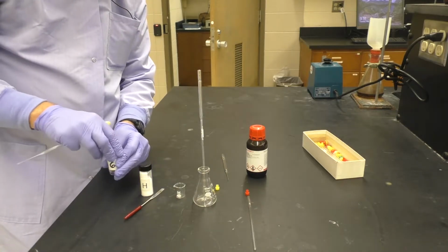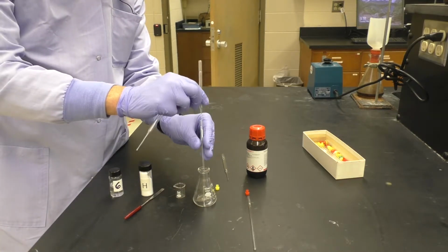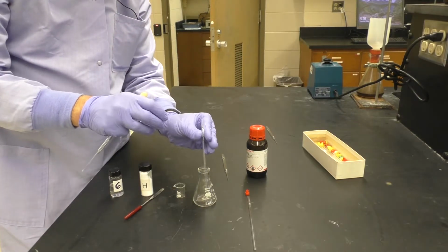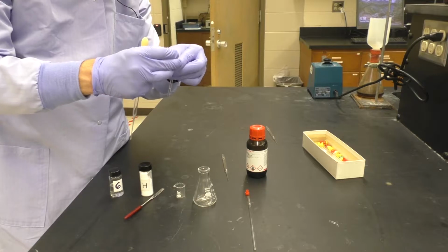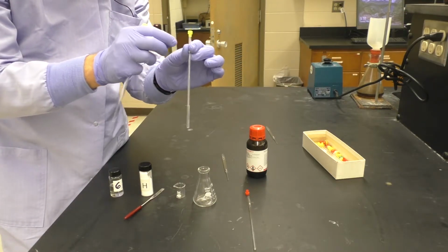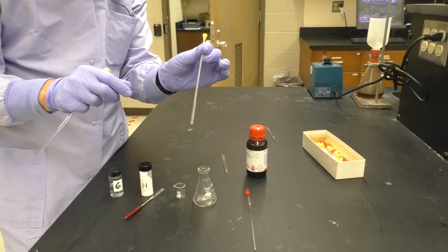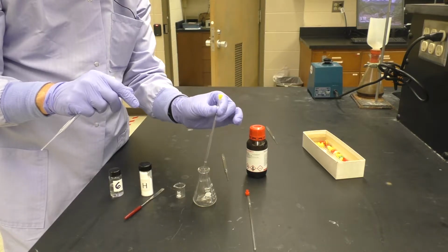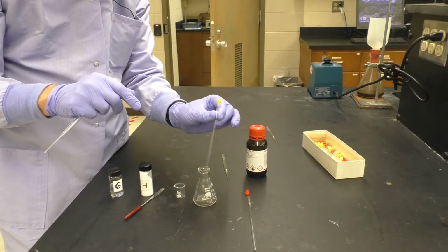We will close our liquid sample here, remove the pipette, place it aside, and simply cap the NMR tube with the NMR cap. And this sample is all prepped. We would want to label it now to know which sample it is. Here I'm using a yellow cap, so I'll keep that in mind until I label it. Generally a good idea to label it right away.